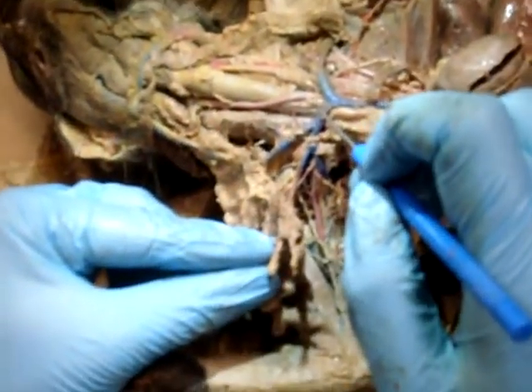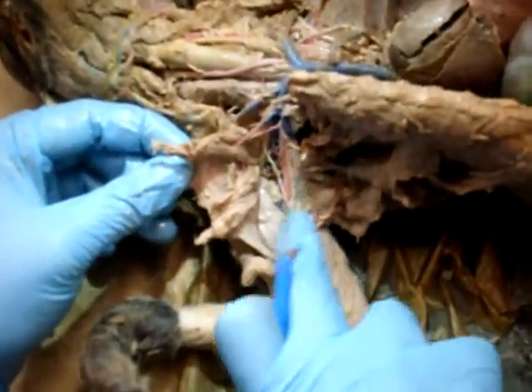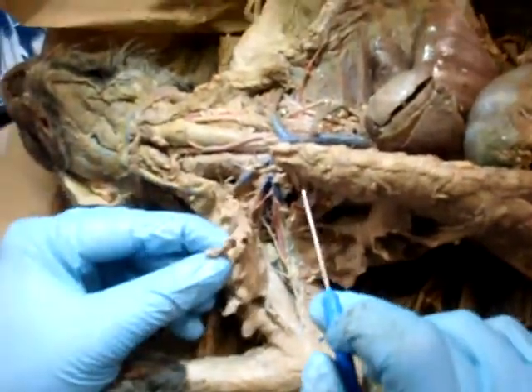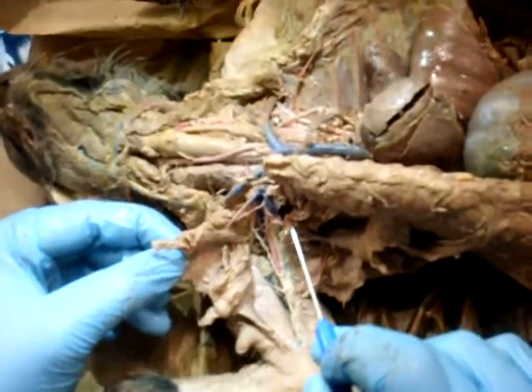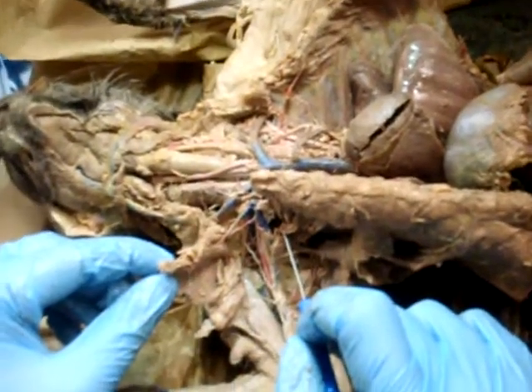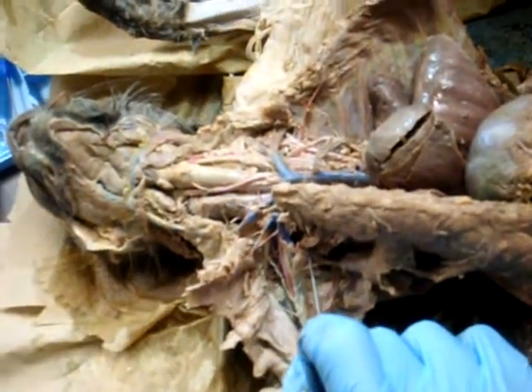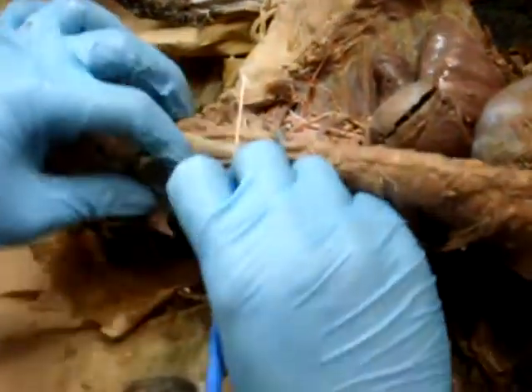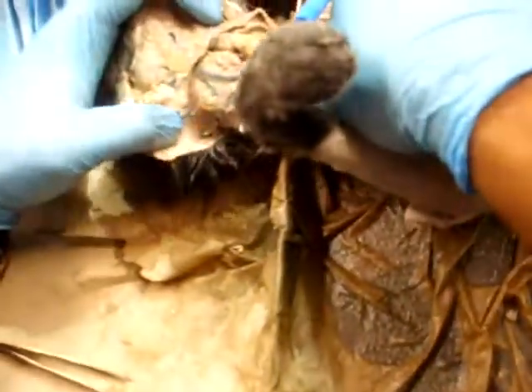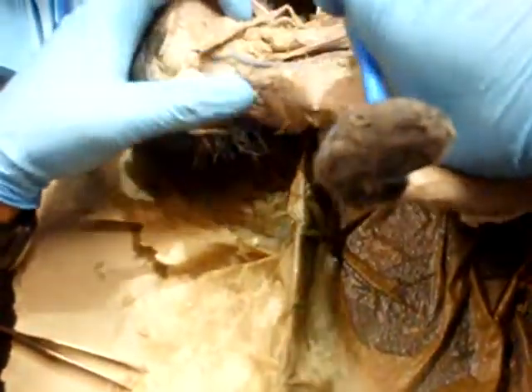And then brachial, radial, cephalic is picture human only. Brachial, radial, because from here it's going to split. Transverse scapular. Wouldn't it be the transverse jugular? There's transverse jugular, but we also have the transverse scapular. Okay, the transverse scapular is over here, 8. But that would go right up, actually. Here. Is that one that's popping out right there?